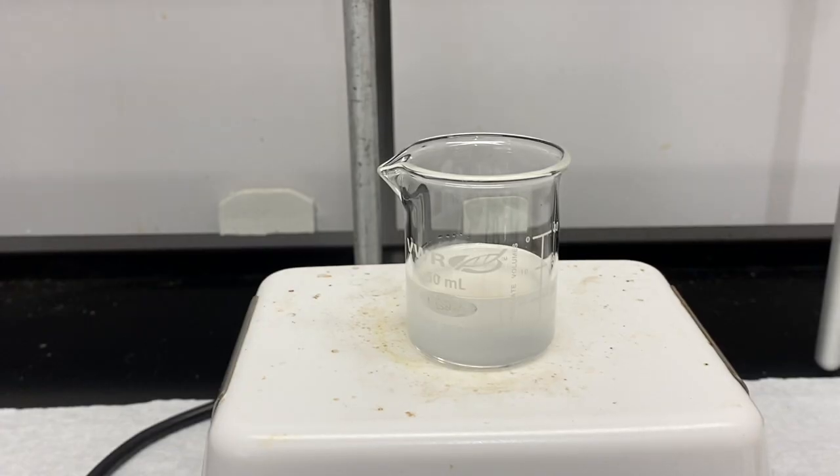Alright, I've got the dichloromethane in the beaker on a hot plate. I've got the heat on relatively low because dichloromethane has a pretty low boiling point, and so we're going to drive the dichloromethane off of, or out of, the beaker and leave us with the oil product. So I'm going to put this on time lapse so you can watch this, because you know you're going to literally watch a pot boil, and when it's done we'll get the masses for you.